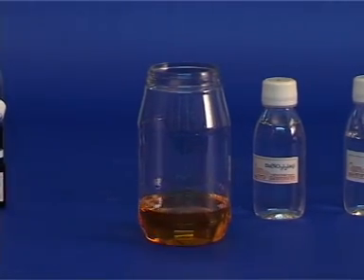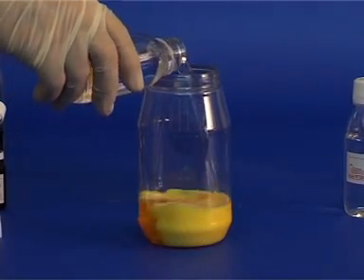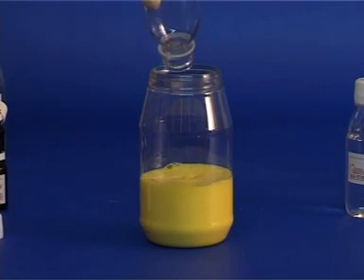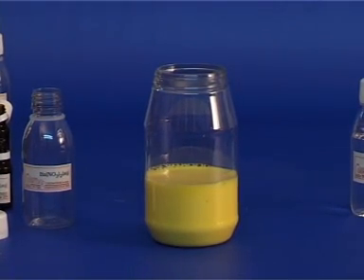Adding bottle 5 will cause the formation of a suspension of solid particles, and the appearance of an opaque yellow color, which can be best observed while allowing those particles to settle or to filter them.